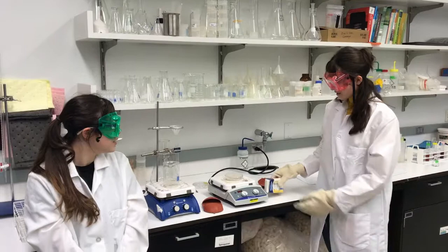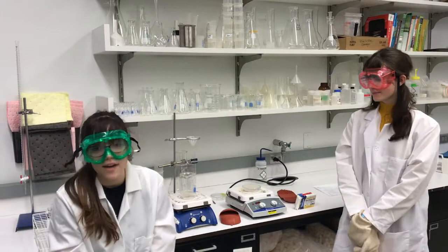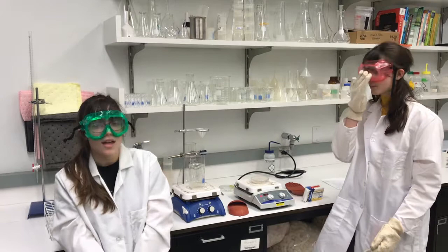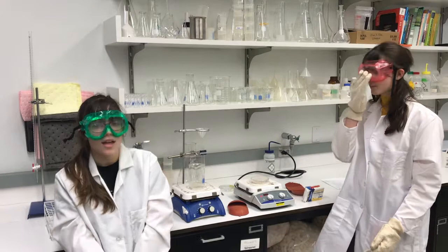The lab involves the extraction and isolation of caffeine from caffeine tablets, followed by the recrystallization. After recrystallization, you can either let it air dry overnight or put it in a drying oven. And when you're ready, you can put it on a hot plate to sublime.